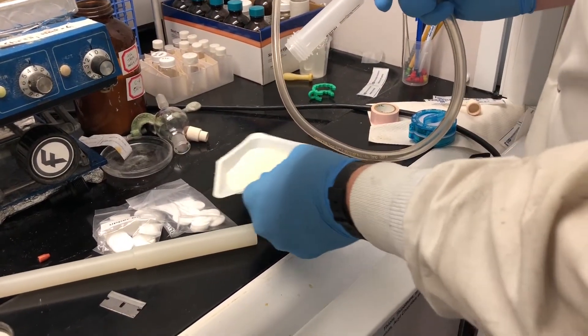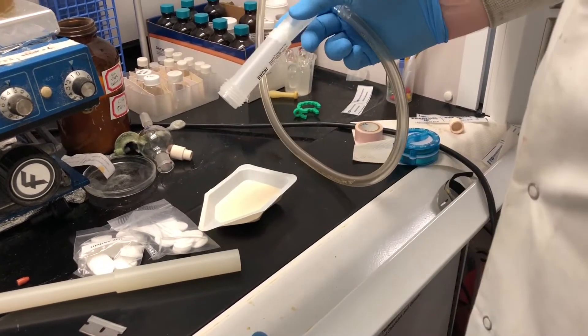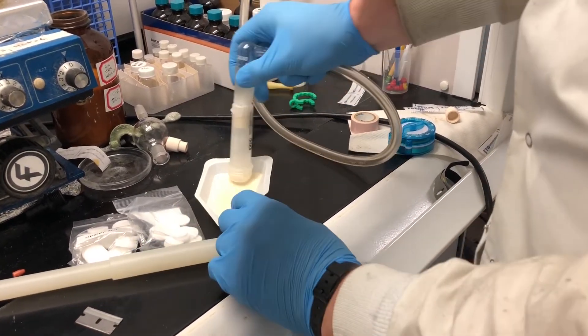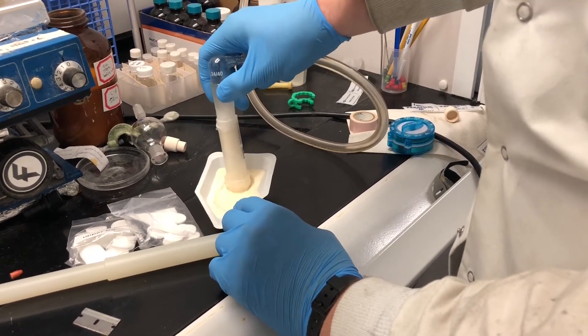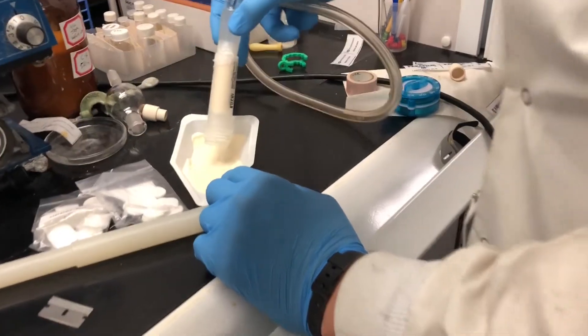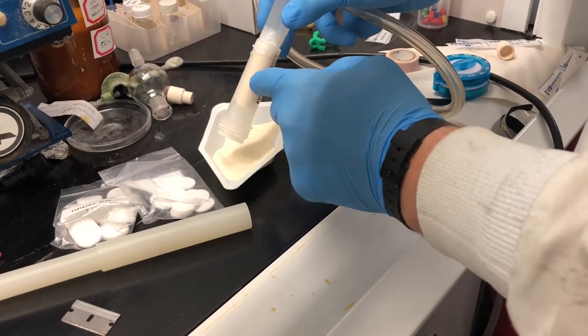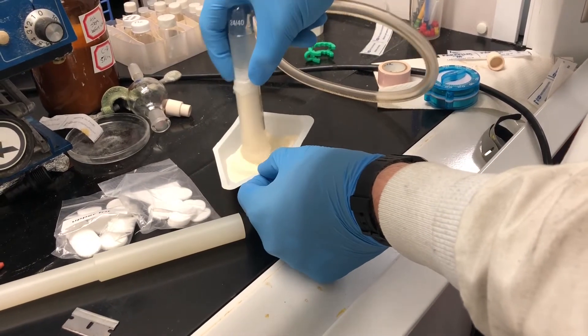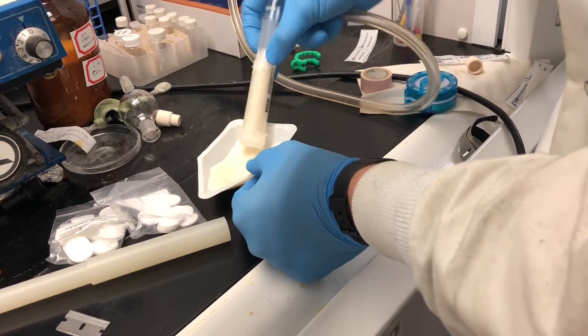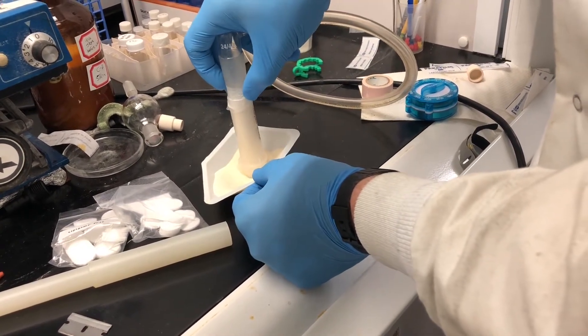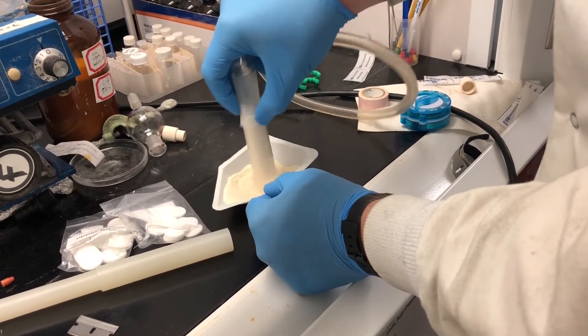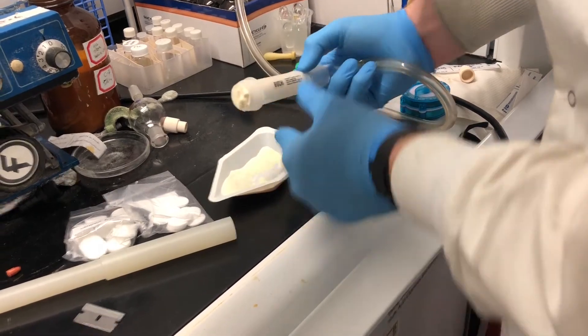Make sure your silica has a nice fine powder. If there's clumps, you're going to have clumps inside your cartridge. You're literally just going to take it and lower it. Let it fill up. Just move it around like this. You can see it filling up the cartridge. Our cartridge is almost filled. Now it's filled.